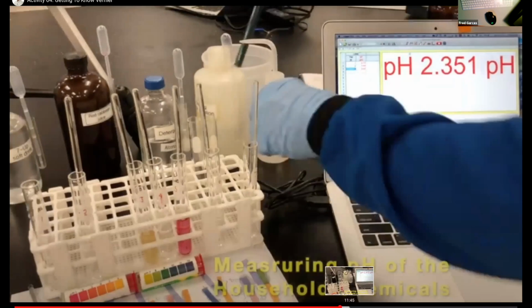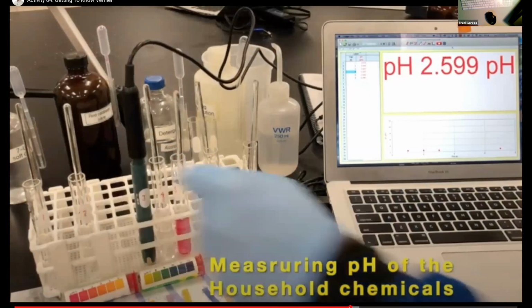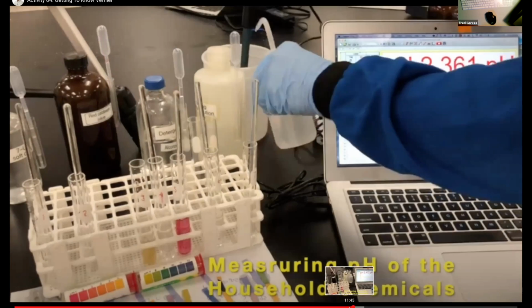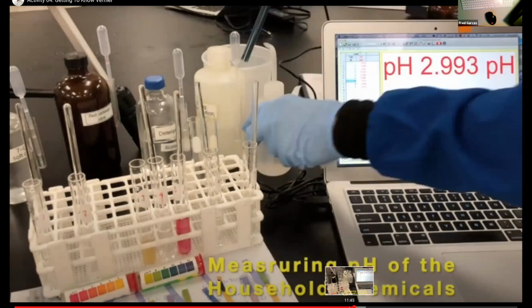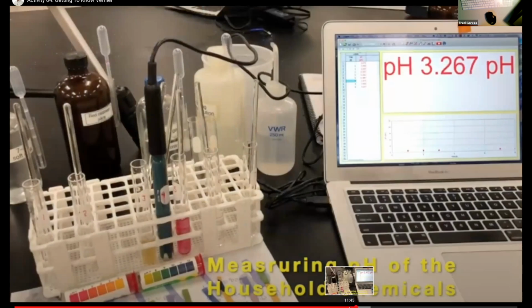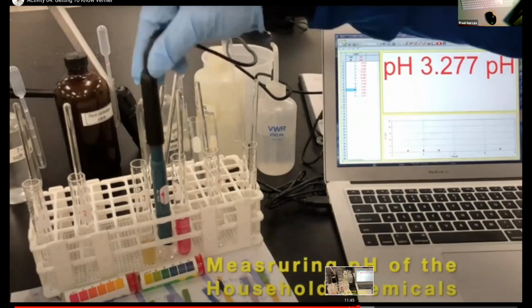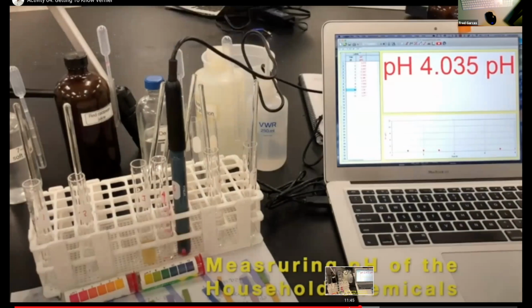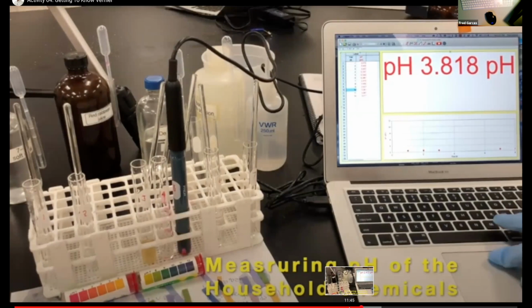Now I'm going to take the pH probe and put it in each of these solutions, and then I'm going to read the pH of each of these solutions. I'm going to do it in triplicate. You always want to do things in triplicate, because if one of them is an error, then you have another 2 to see whether the error is on the high side or low side, or just to confirm that it's correct.